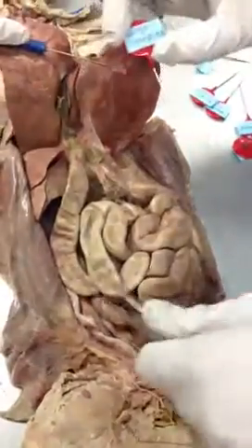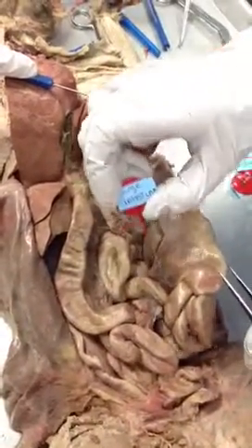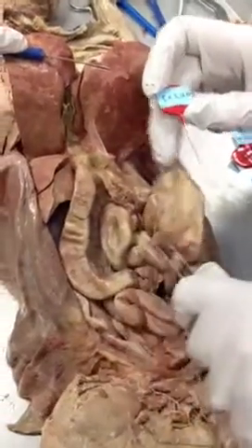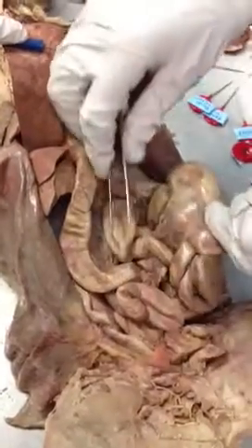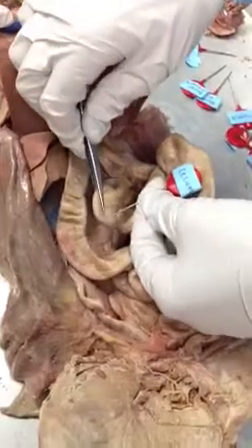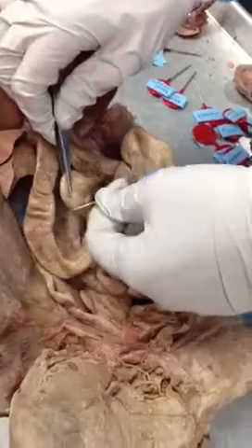Next, we pass on into the large intestines, which again is an area of intestines. It's a whole bunch of parts, and we're going to break it down to those parts. So after the small intestine, we enter the large intestines, and we start off with the cecum. In terms of where you're going to find it, it is just inside of the small intestine. I'm going to switch hands. Right here, this little sac is your cecum. The food passes from the small intestines to the large intestines, and the cecum is this whole spot right here. It's this little flap.